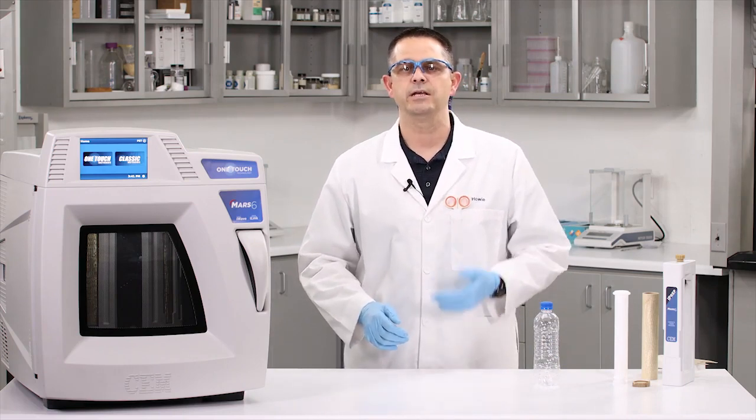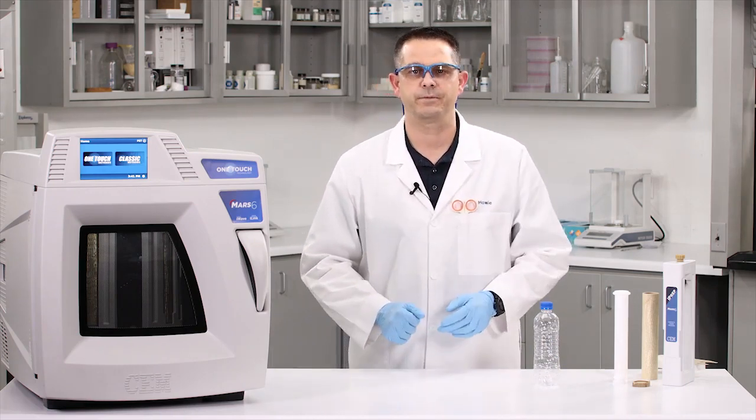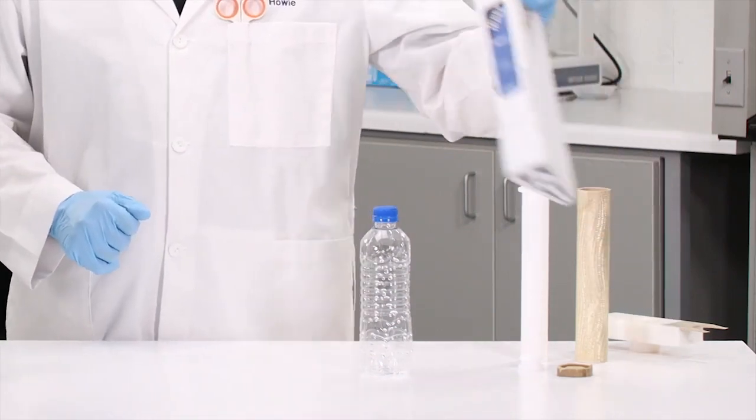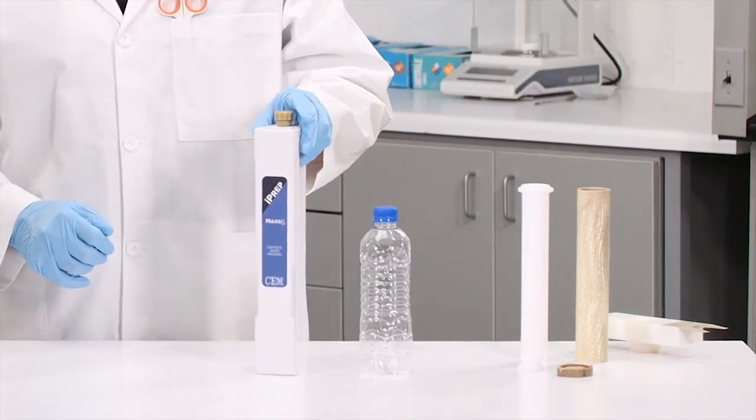In the past, sulfuric acid had to be added to nitric acid in order to get a total digest. But with the iPrep vessel, we can now digest a sample in nitric acid only. This will make the digestion and analysis cleaner and much easier.